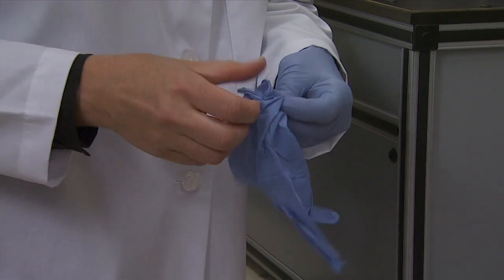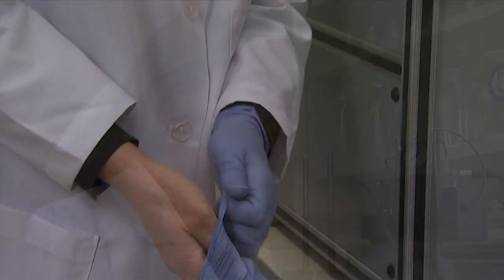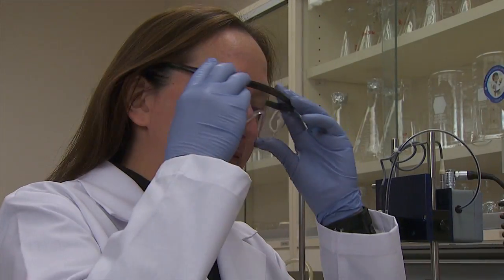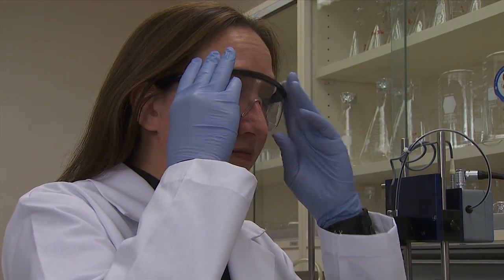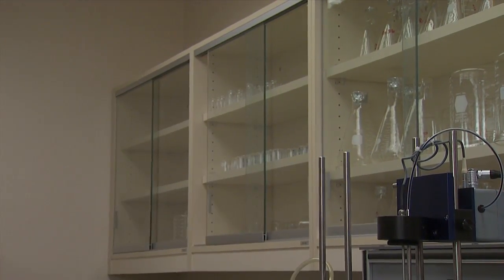Personal protective equipment includes gloves, safety eyewear, and a lab coat or apron.